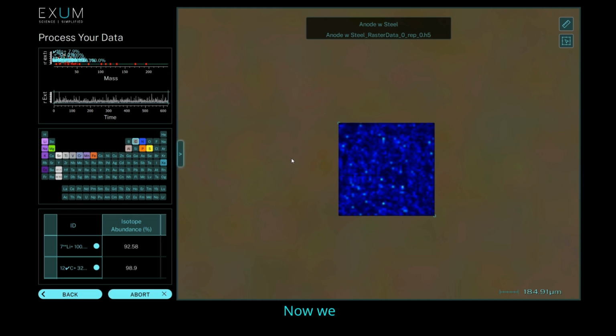Now, we did deliberately contaminate this material with stainless steel particles. The stainless steel particles are primarily comprised of iron, chromium and nickel with an average particle size of 38 microns. So we first analysed the area in a large 1mm by 1mm raster with a 20 micron laser spot size.